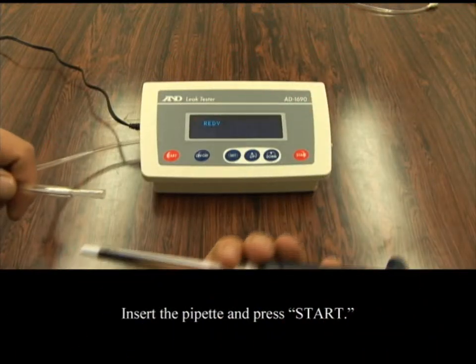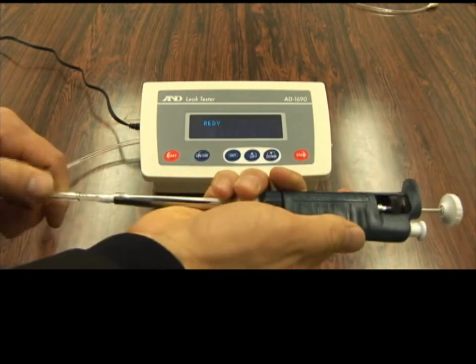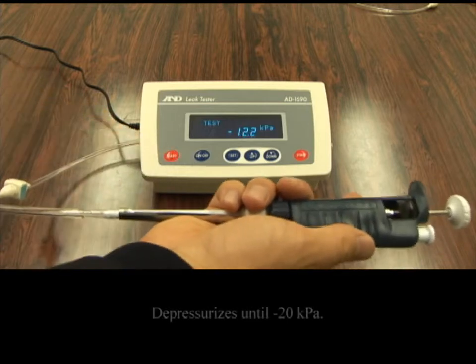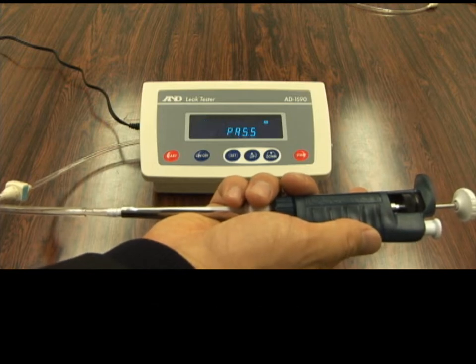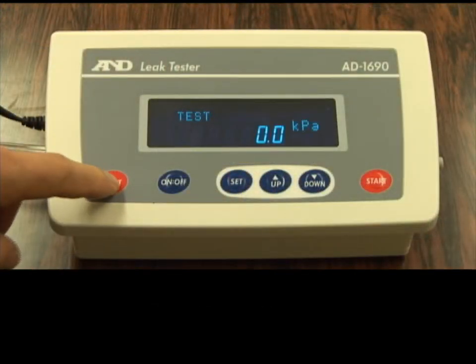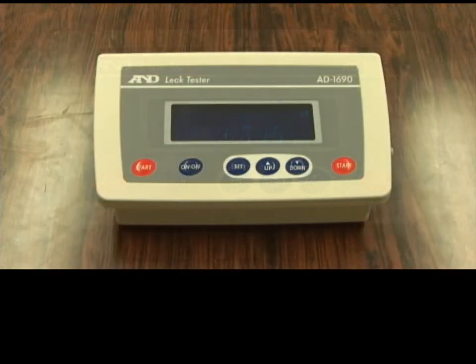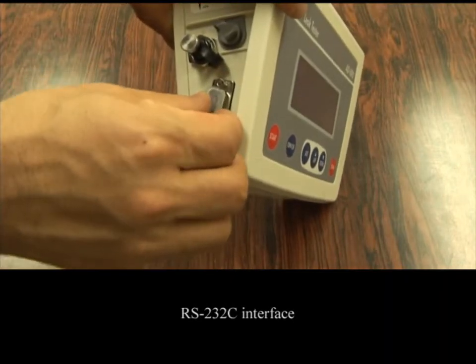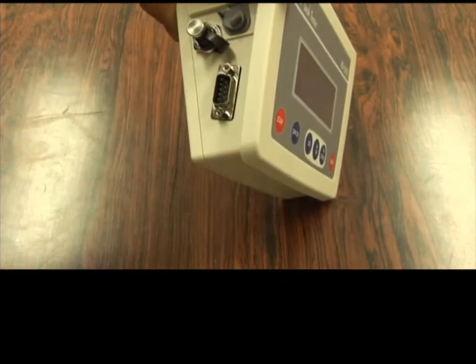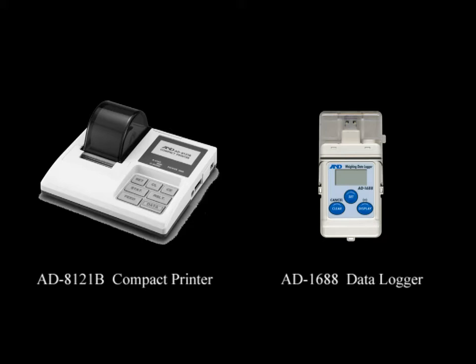Finally, insert the pipette into the tip of the attachment and then press the start key. The pump starts and depressurizes until -20 kilopascals. The AD1690 displays pass for leakage at or below the set value and fail for leakage above the set value. The AD1690 is equipped with an RS-232C interface, so the data can be output to a PC or an A&D peripheral device such as the AD8121B or AD1688.